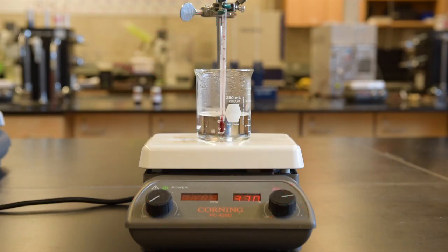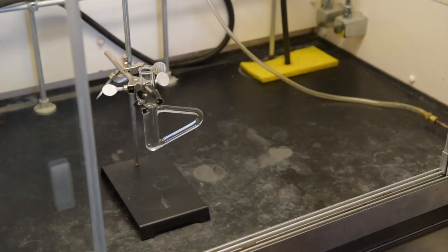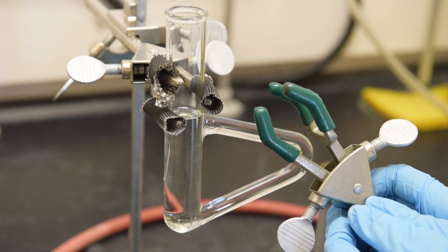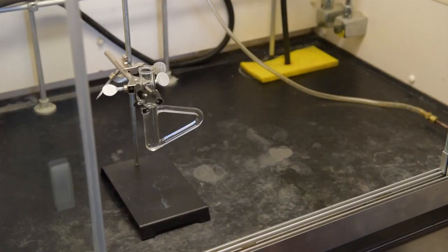Boiling a beaker of the compound would allow for a very rough and inaccurate boiling point determination. It is exceptionally difficult to determine the temperature at which the boiling started. In order to perform a boiling point determination, you're going to need a Thiele tube filled with oil attached to a retort stand with a clamp. Notice that the regular green plastic finger protectors have been replaced with a more heat-resistant finger protector. This will already be set up for you when you come into lab.